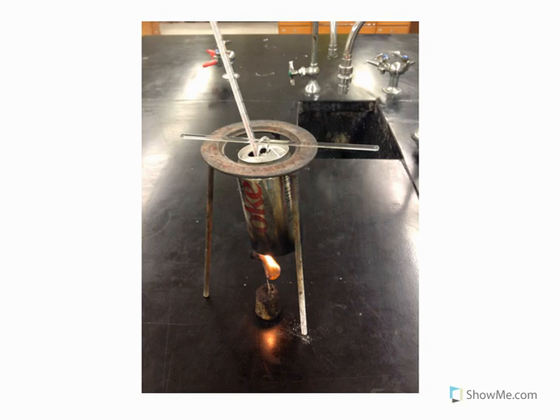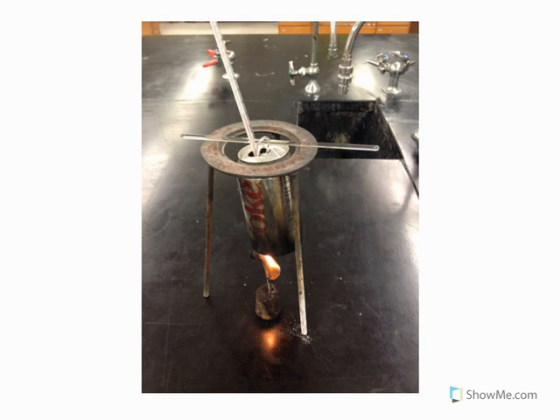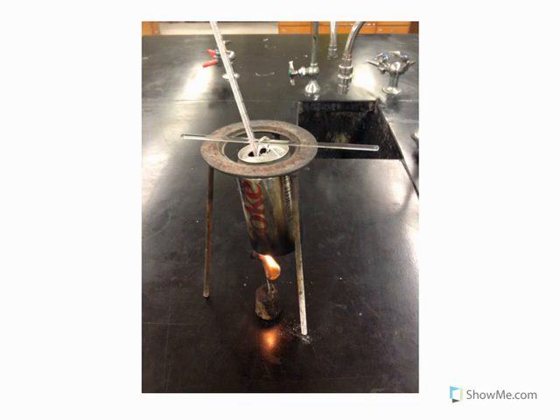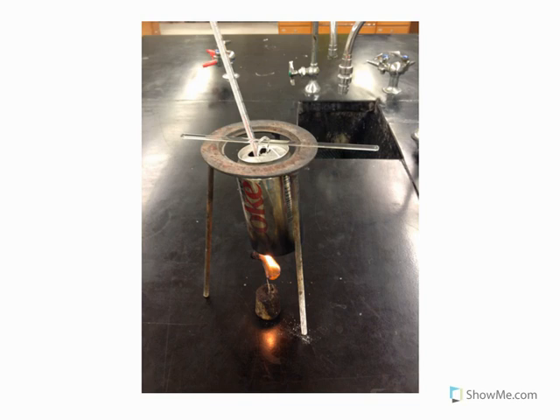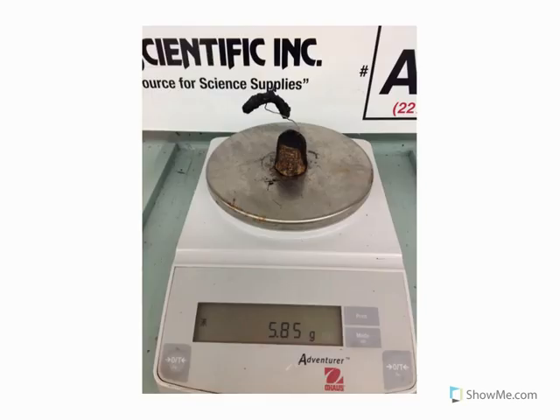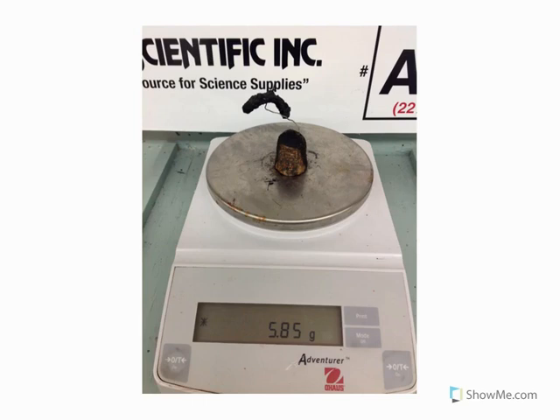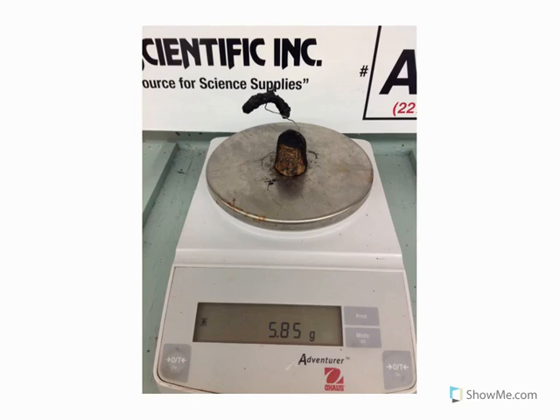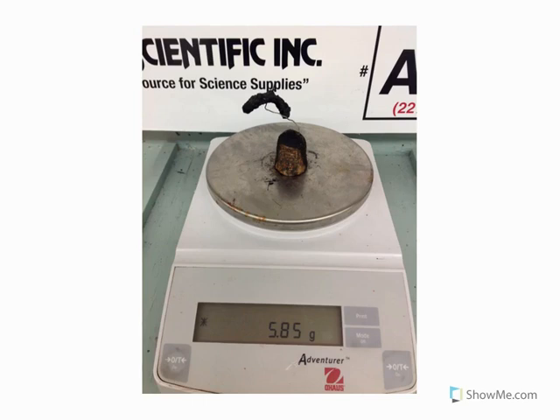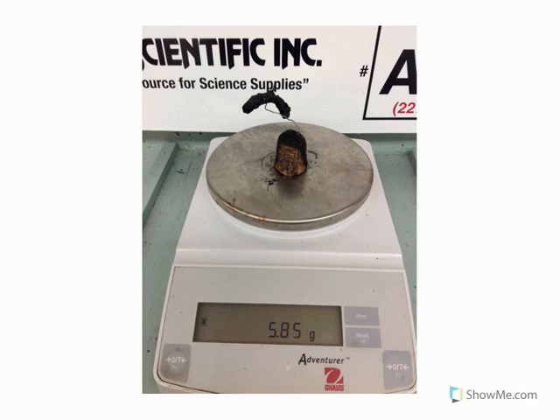Light the Cheeto and center it under the soda can. Allow the water to be heated until the food sample stops burning. Record the maximum temperature of the water in the can — that will be your final temperature. Measure and record the final mass of the food holder and sample, and then clean the bottom of the can and remove any food residue from the food holder.